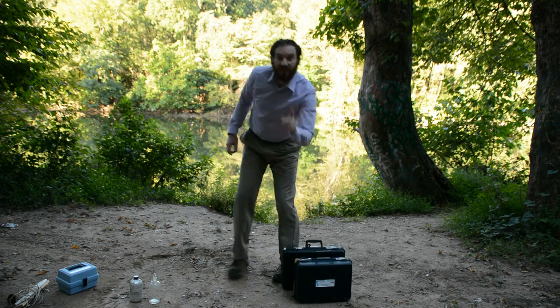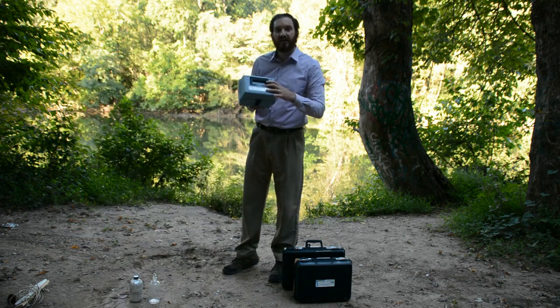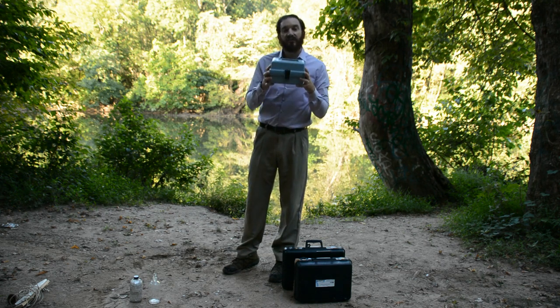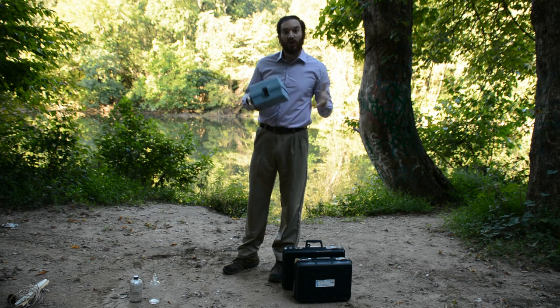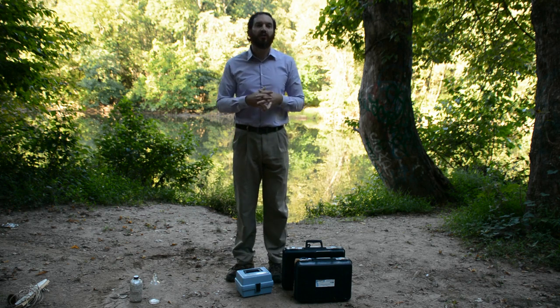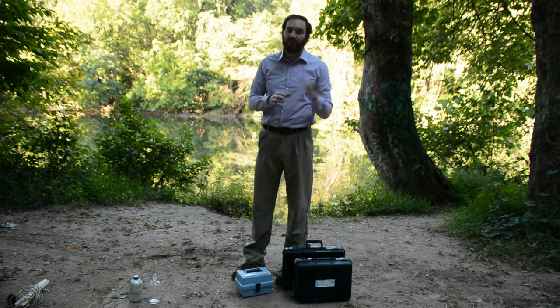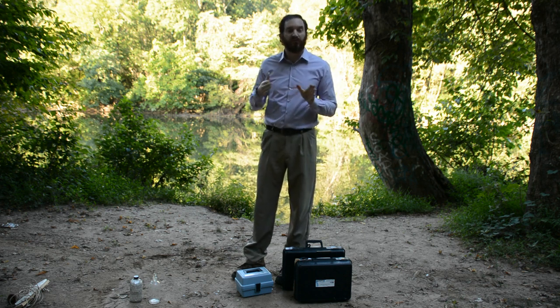And the third way in which I'm testing is with this company. This is HACH, H-A-C-H. So when you see the 3 different test results, I am taking 3 different tests to calculate the dissolved oxygen. Why am I doing 3 different values? Because I want to make sure that I have an average of different ways, and that way I can calibrate. If I just use one, we know our potential error and potential precision could be way off, but I'm going to use all 3.